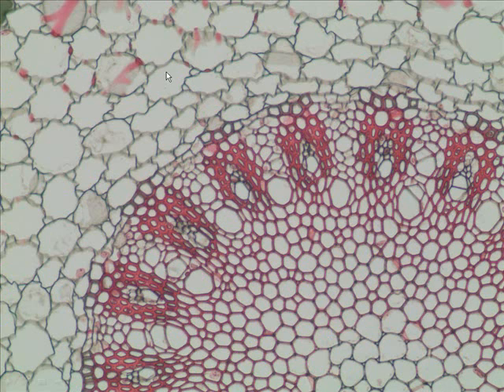And so let's name them off real quick. Type of tissue, parenchyma. Region of the root, cortex. Name of this cell layer right here. It's got some thickenings at places. Endodermis. What is the layer of cells just inside the endodermis? The pericycle. What's that big cell right there? Xylem. What's this little green patch right here? Phloem. What type of tissue do we have in here? Parenchyma. What's this region of the root? Pith. That is right.